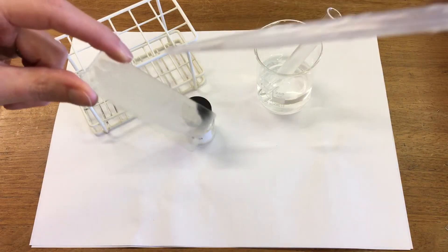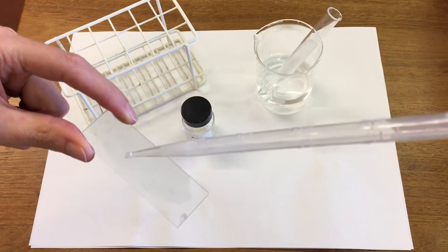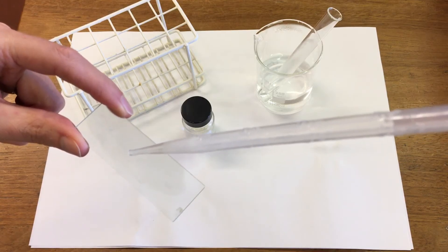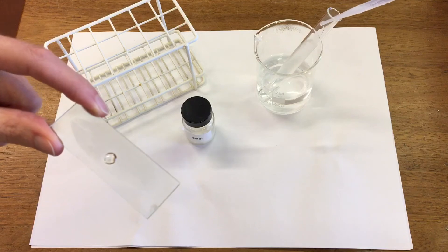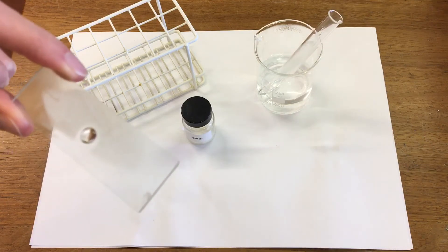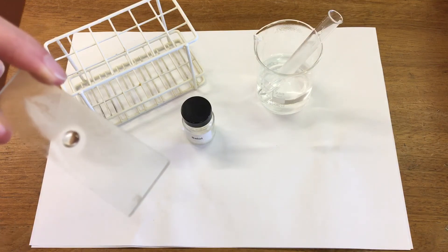Take some of the liquid salol. So you can see the liquid salol on the slide.